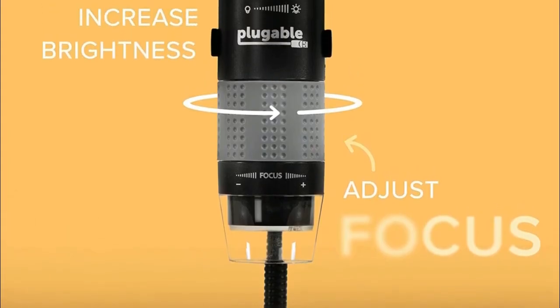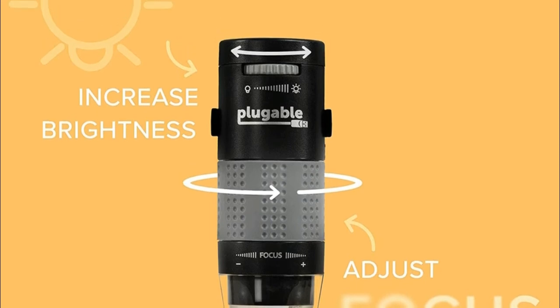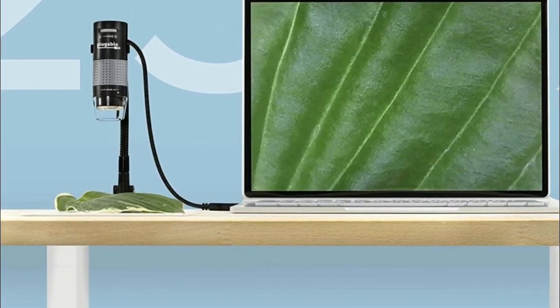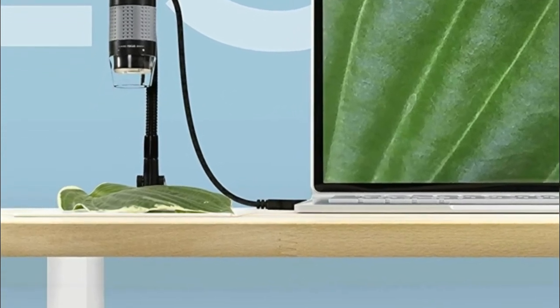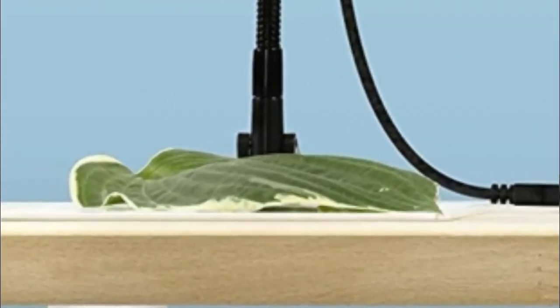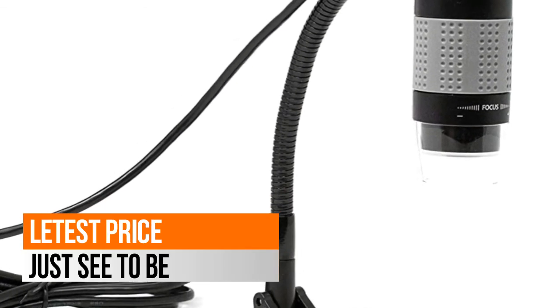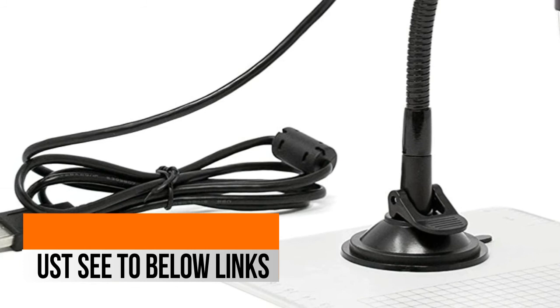Users with an Oculus Rift may require additional setup. 2.0 megapixels, up to 250x magnification. LED halo light with brightness adjustment control. Flexible arm stand with observation pad includes graduated marks for easy measurement.